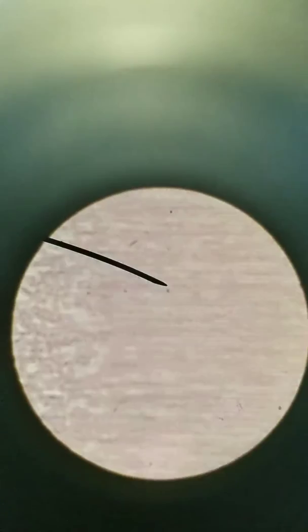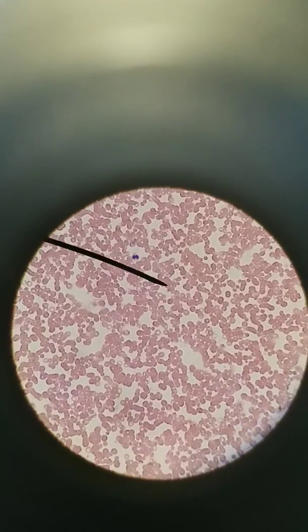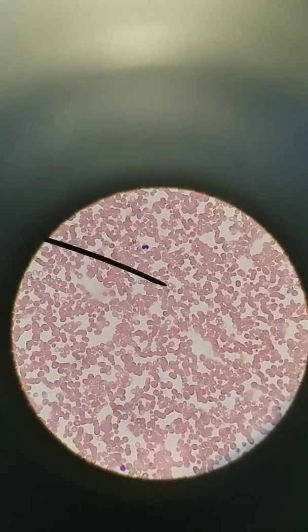This is at 100x. Here we are at 400x total. By being round and flat, that gives these red blood cells a dimpled shape. You see how it's lighter in the middle and darker towards the edges? It's dimpled. Imagine a ball, but deflating it on either side, so it's dimple-shaped. By being thin and flat, this allows red blood cells to carry more oxygen on their hemoglobin proteins inside of the cell and allows them to transfer it faster. We want to have quick diffusion of gases, both oxygen and carbon dioxide. So that's another good example of a connective tissue.